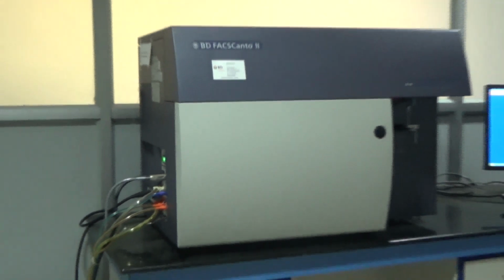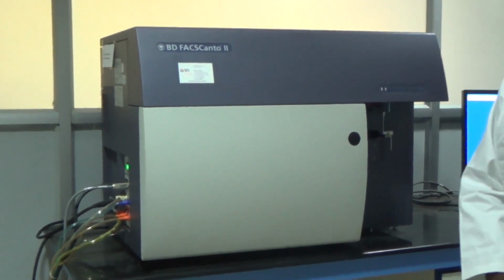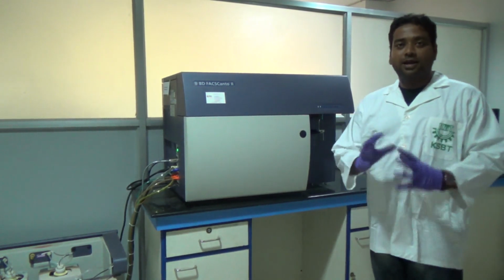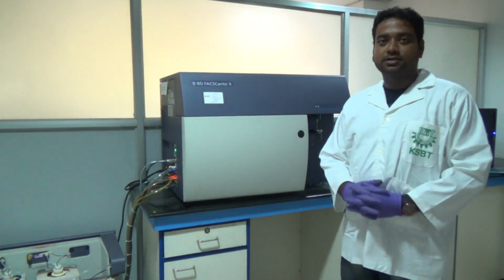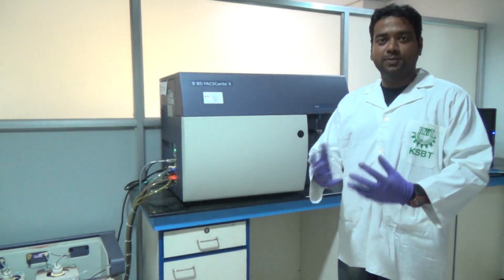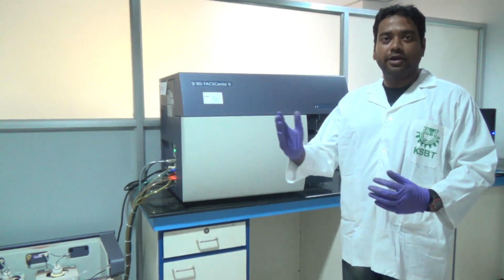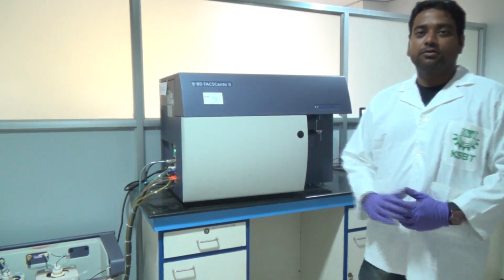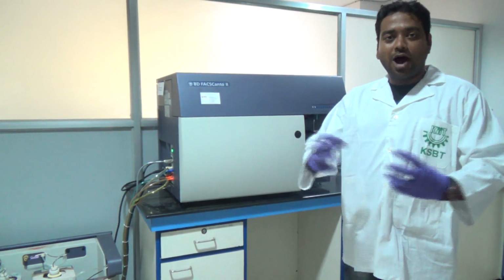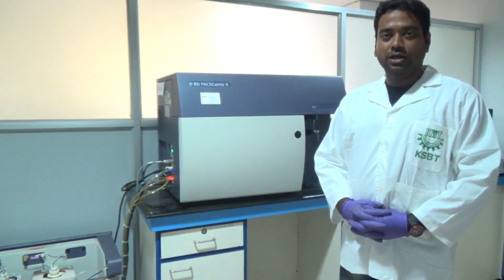After fluidics, next comes optics. As the name suggests, this machine will count different numbers of cells with different color marks. Suppose we stain our markers with specific colors, for example red, blue, green. This instrument can detect those colors. So how is it counting those colors?